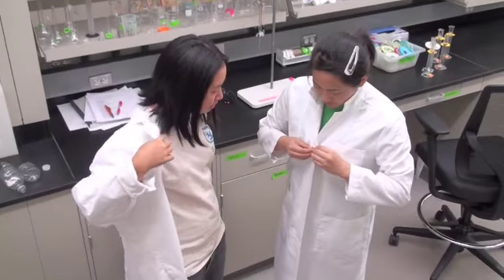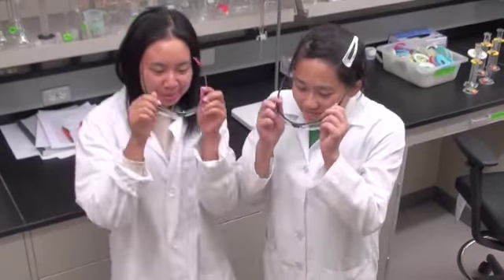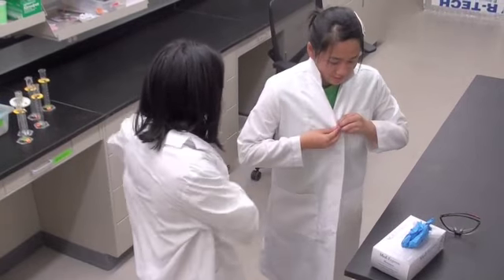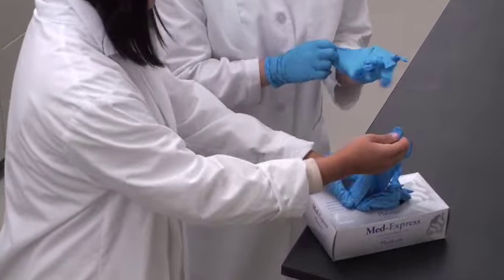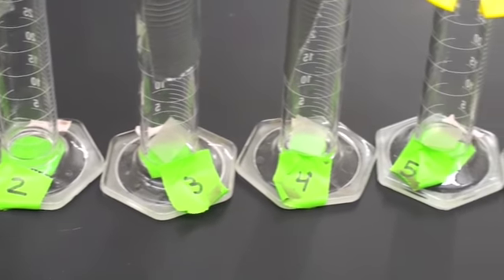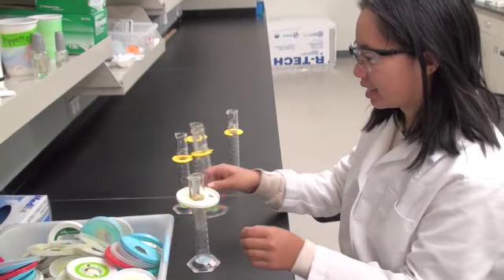We wear proper lab attire when setting up our experiment. This includes safety glasses, closed-toed shoes, lab coats, and gloves. Active biomass will produce some gas without the addition of other materials. It is important to include samples that contain no investigated material, called control samples or blanks. Set up these graduated cylinders using the exact same method, and verify that the cylinder is empty before you pour in the biosolids.